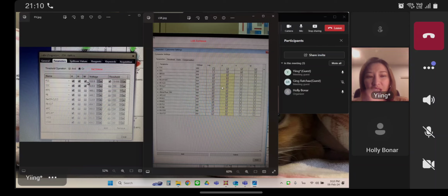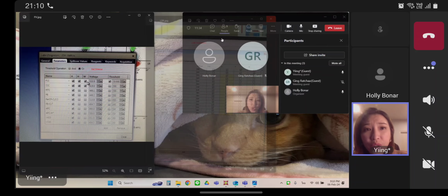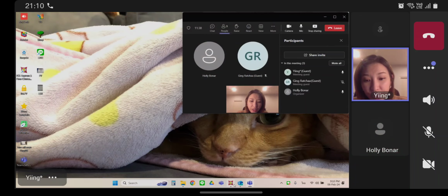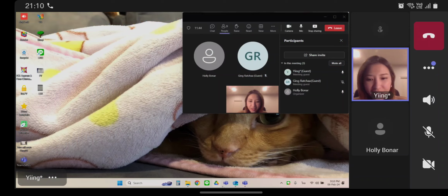I think the machine I save the data from the machine, same the FACSDiva. And sometimes different instruments will just write the files differently. I'm not sure. Hold on. I'm going to load it on my computer. Okay. I will show you where I create a new layout for you. Okay. I think you can get it.